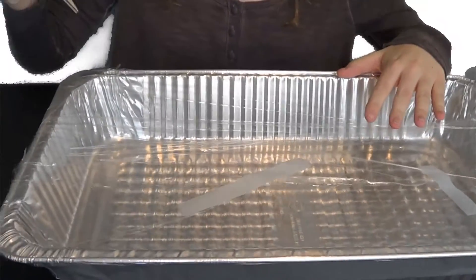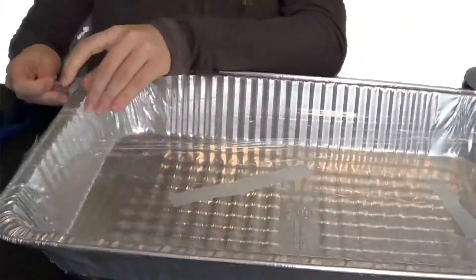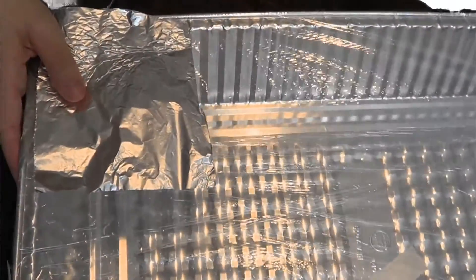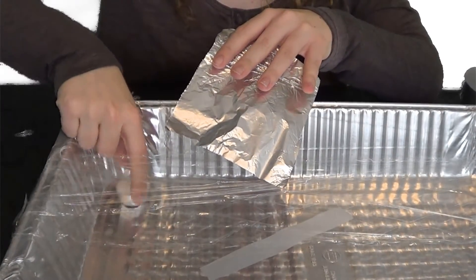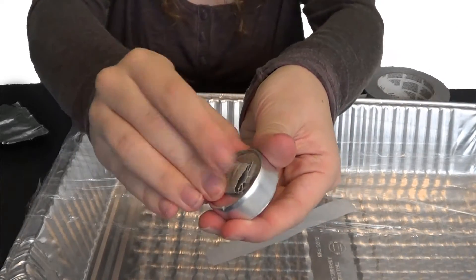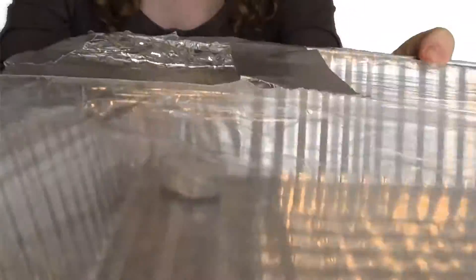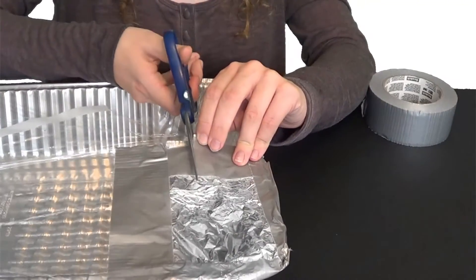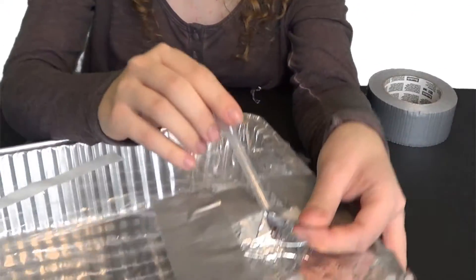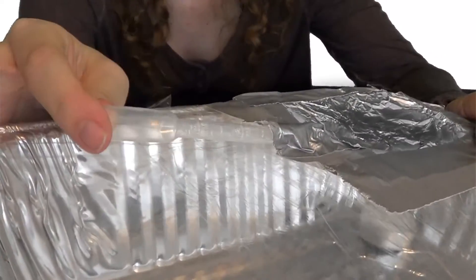With the plastic wrap sealed down, take your pair of scissors and cut a small square out of the plastic wrap in one of the corners — this is where you're going to put your candle. Take a sheet of aluminum foil and cut out a piece slightly larger than the area of the square you cut out. At this point, put your candle in the pan; I'd recommend putting a small piece of adhesive on the bottom so the candle doesn't move around. Now tape the aluminum foil over the plastic wrap, but leave a small section without any adhesive. This is where you'll take your small plastic pipette and insert it between where the aluminum foil and plastic wrap meet so the dropper can reach inside the pan.